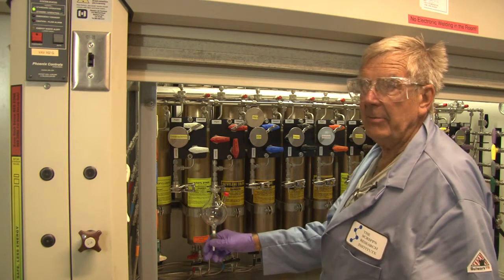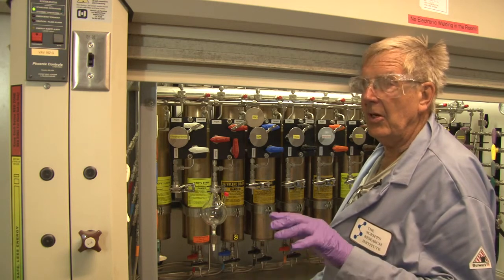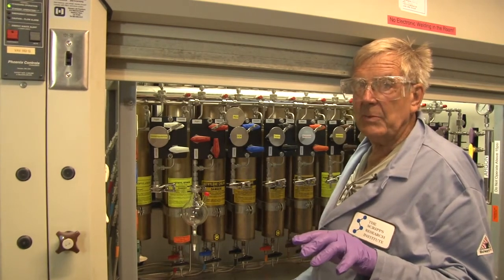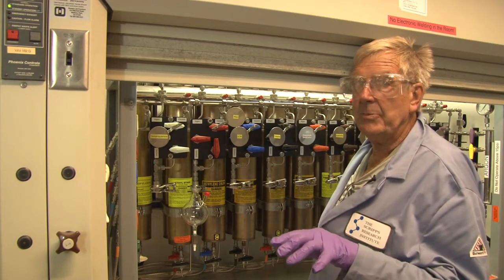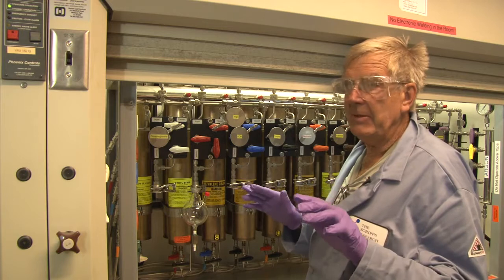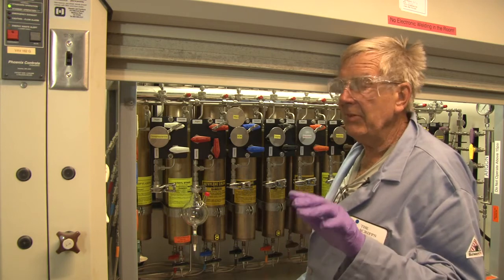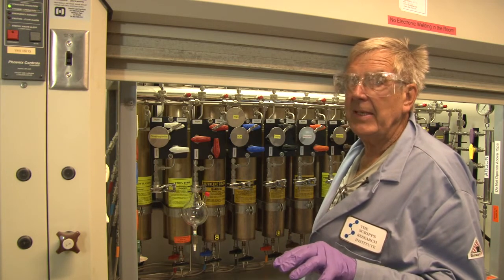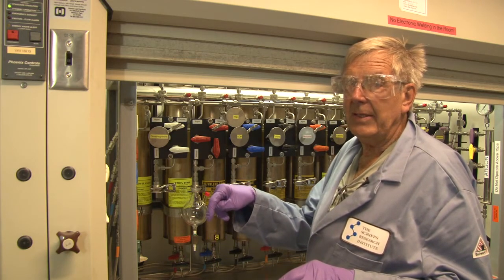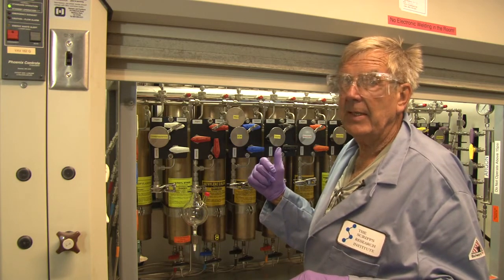When I say argon, I mean it has to be ultra-high-purity argon — UHP inert gas — but never regular industrial grade. The difference between regular inert gas and UHP gas can be as much as 40 ppm of water, rust, oxygen, and other contaminants. Never use industrial grade, because what you degas with determines the water and oxygen content in your final product.